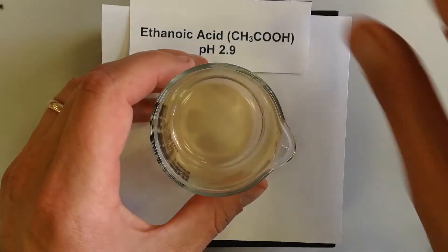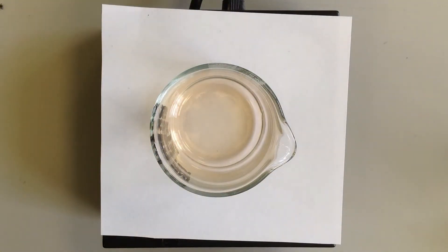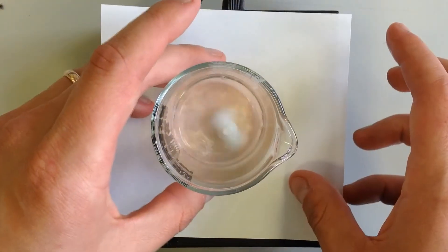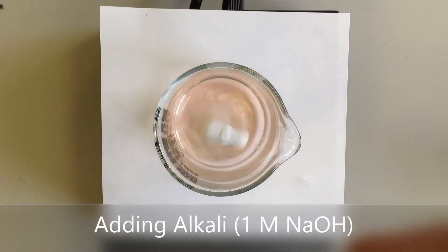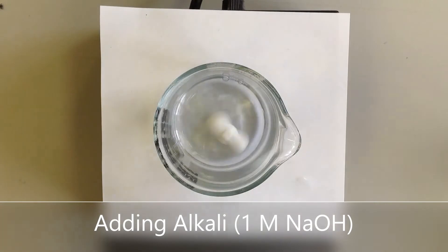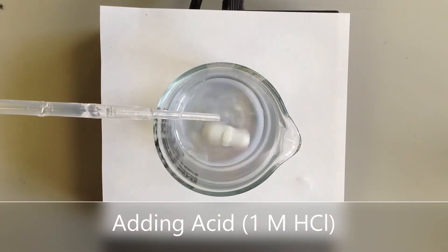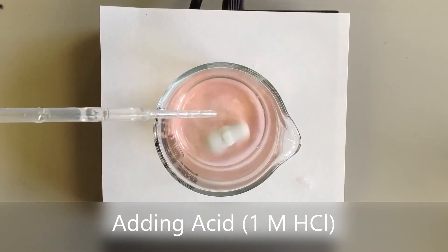If I start with a solution that just contains, say, hydrochloric acid of a similar starting pH, and just put a magnetic stir bar in that, and I add NaOH to that — one drop makes it alkaline. And similarly, if I add HCl at the same concentration, one drop brings it back.